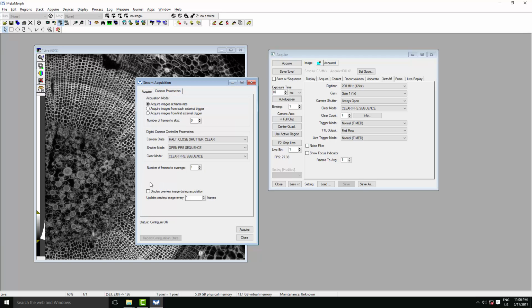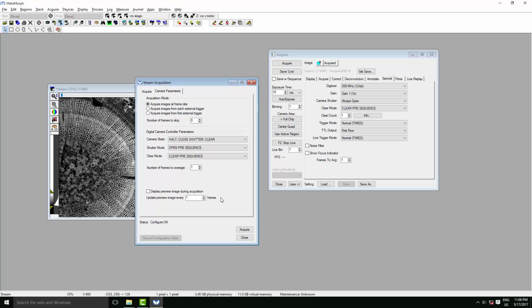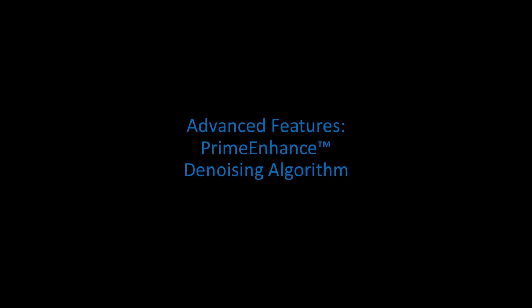At the bottom here of the Camera Parameters tab, you can choose to display a live preview during the acquisition, but depending on the speed of your computer, this may harm performance. So quickly to record this 400 frame video, if we go to our capture and scroll to the end, here we have 400 frames in just under 5 seconds, meaning that we're capturing at our expected frame rate for the 12-bit mode.